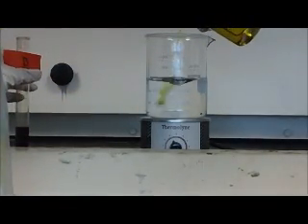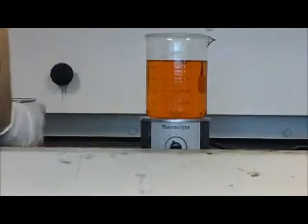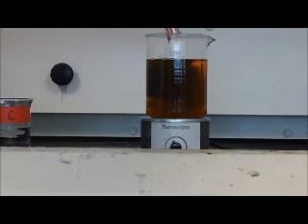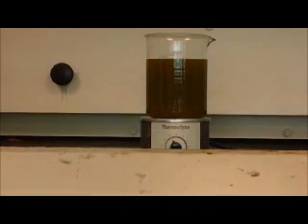C first. As you can see, the color of the solution changed from a light yellow to a dark red, or dark orange, actually. And here's the indicator. It'll stay cloudy and mucky green. Yeah, it's not a very attractive color. So right now, the reaction is occurring where cerium is being oxidized and reduced between Ce4 plus and Ce3 plus.